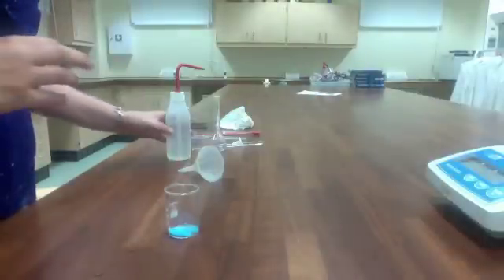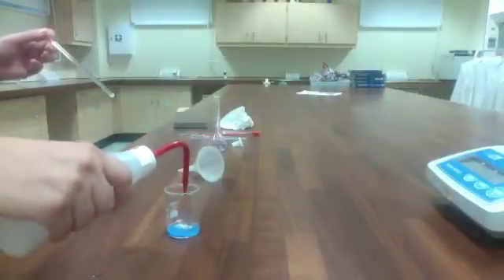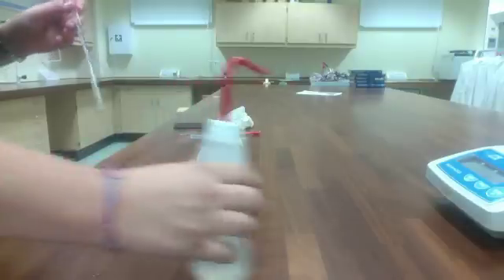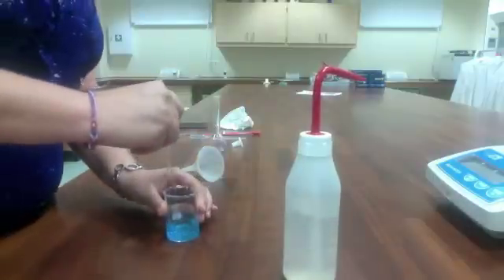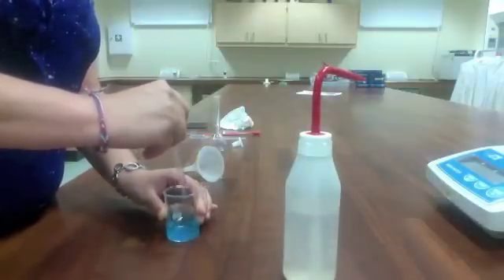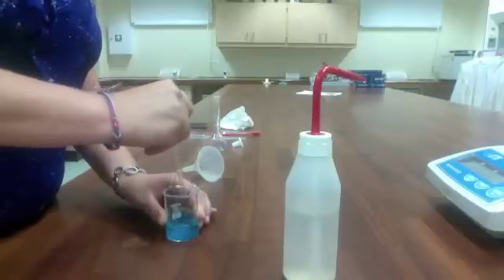When we've done the correct amount of mass, we'll add some water to the beaker, about half of the final volume. I'm doing the example from the pre-lab here, which was with copper 2 sulfate, making it to a final volume of 50 milliliters. So I'll add about 25 milliliters to the beaker here.